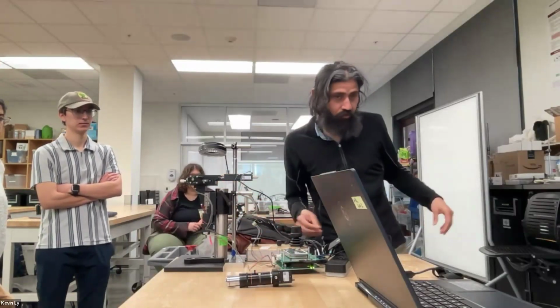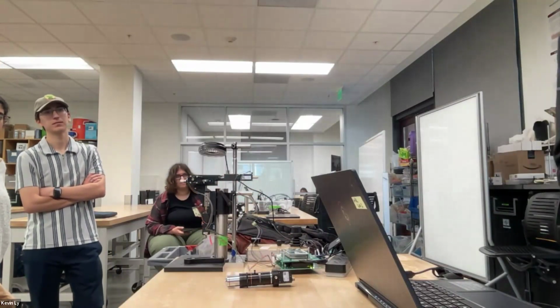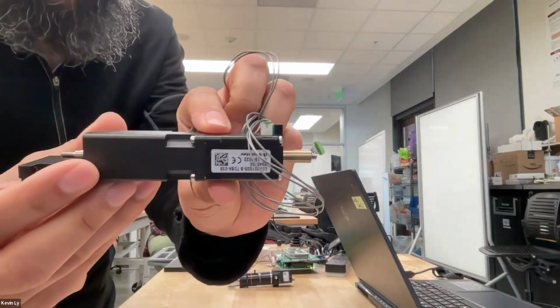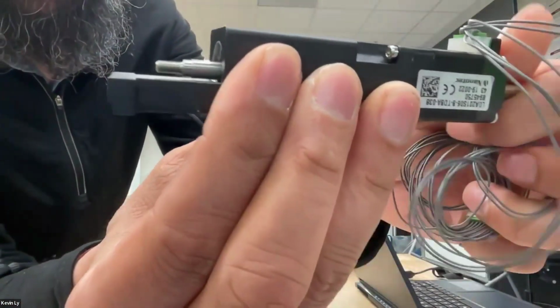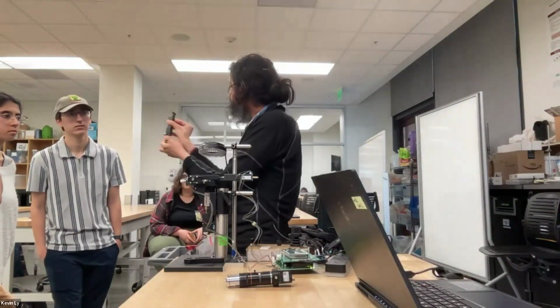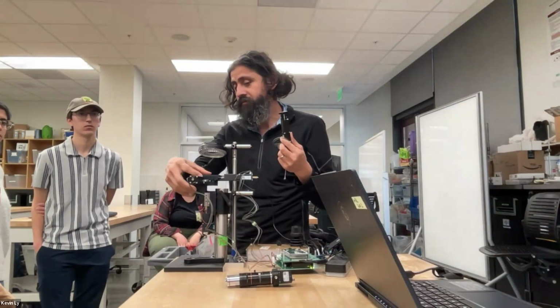So one quick module I want to show you is when we got started on designing and driving linear actuators. This is one we ended up choosing. And again, this is all open. It's all described. You can see it has both the motor, but then that's the linear actuator. You can see I'm spinning and something is moving, right? Right there. So now, finally, if I have 3 of these, I can do X, Y, and Z. That's exactly what's here. We just machine this little plate, and there's little bearings in here.